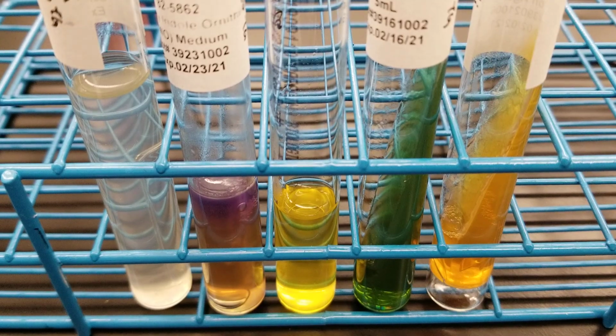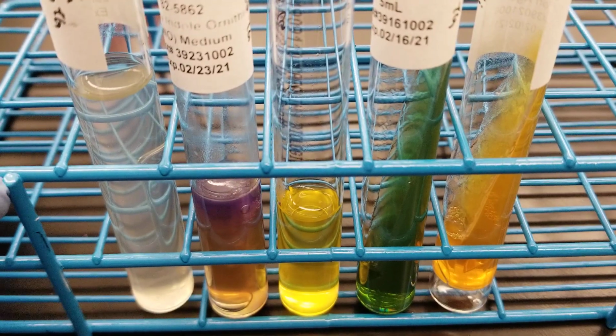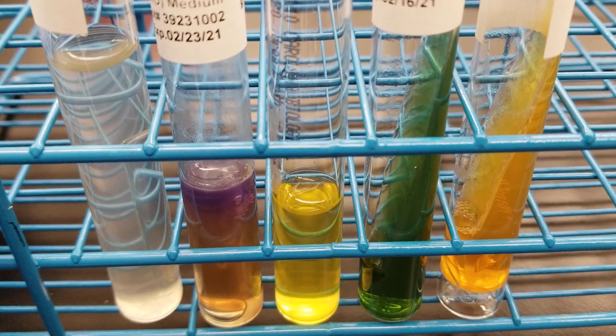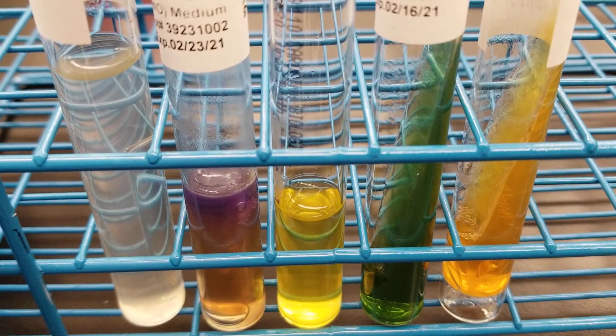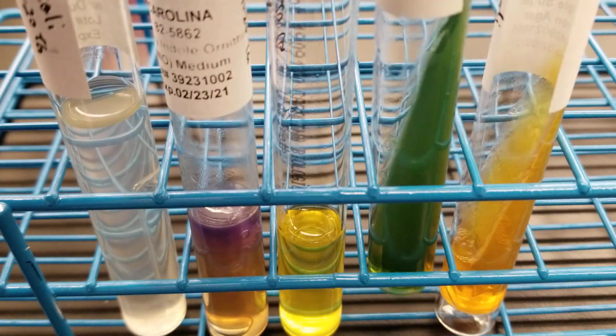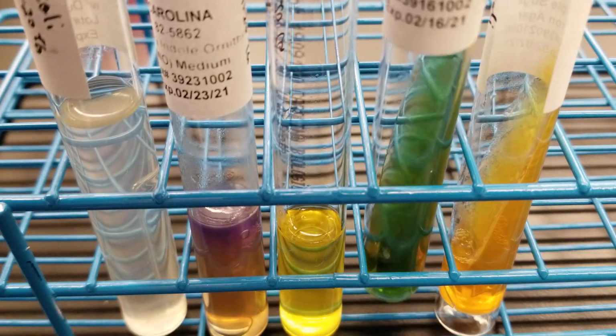Okay, this is E. coli, and we did end up getting new strains this year, so some of these results may not match previous videos because they're a different strain of the organism. Again, this is 24 hours incubation. If you look at it, it's very similar to Enterobacter aerogenes. However, Enterobacter aerogenes is known as the citrate positive E. coli, and if you can see, this citrate is negative.